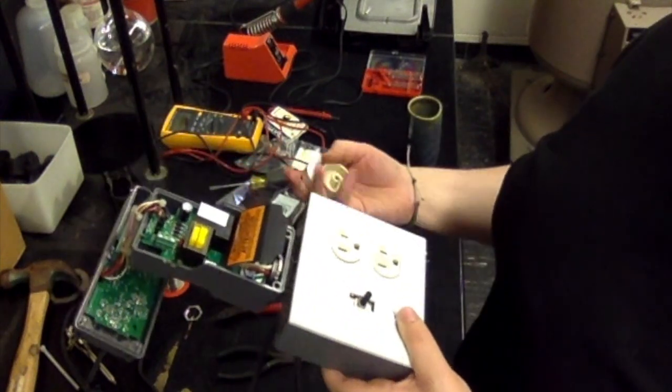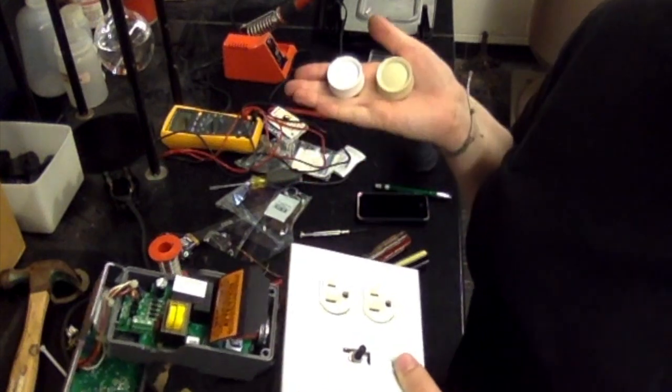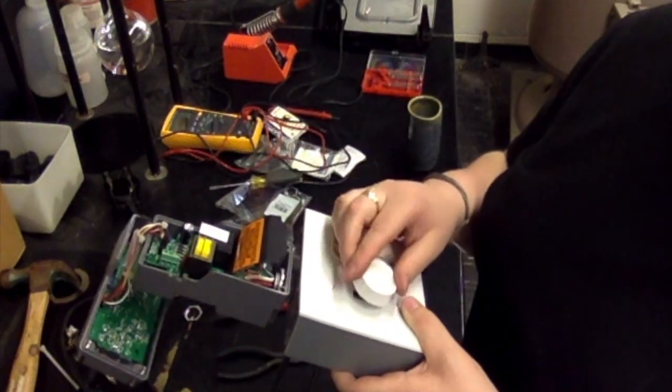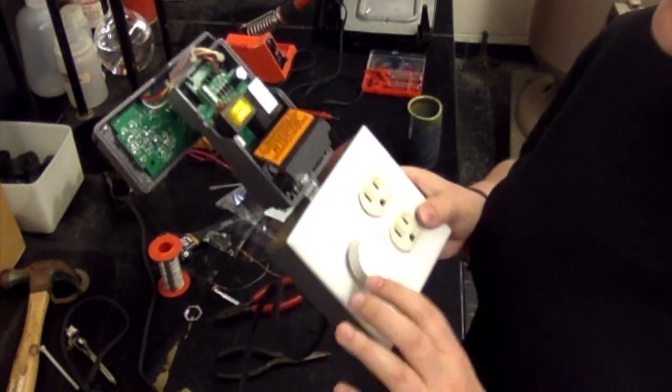You can also put on the knob. You can choose between the two they give you of beige and white. It doesn't matter. I like the white one because it matches, but it's alright. And really, we're almost done.